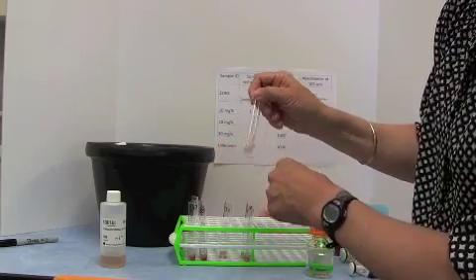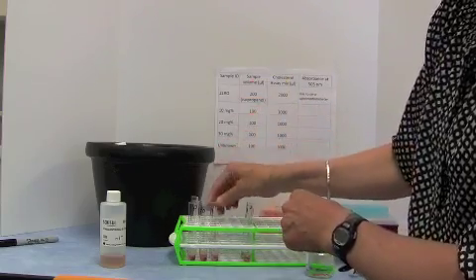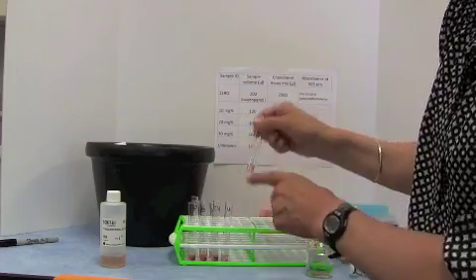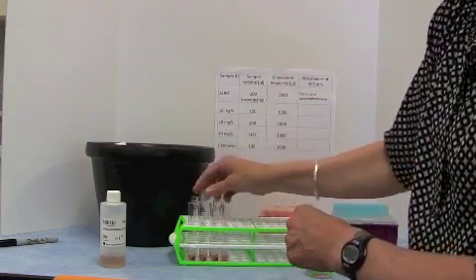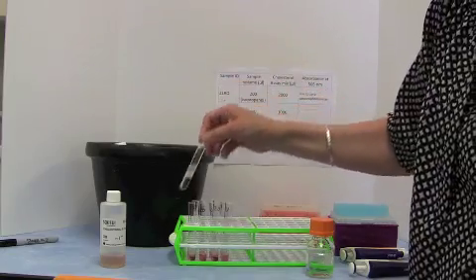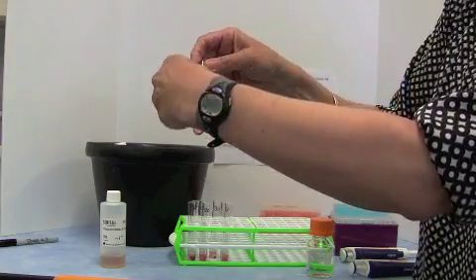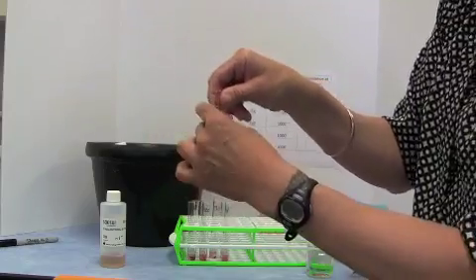So the 3 enzymes in this mixture are converting the cholesterol into products, and hydrogen peroxide is generated, which the final enzyme takes the hydrogen peroxide plus some substrates and makes this pink colour. Now you may be able to see, so for the unknown it's still this kind of brownish colour, and for our standard it's already developing some pink colour.